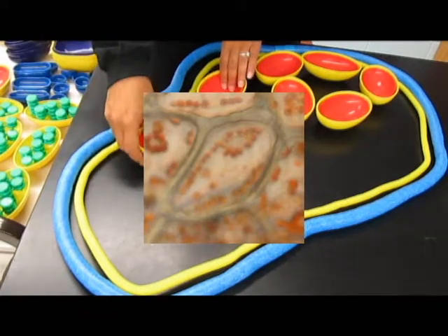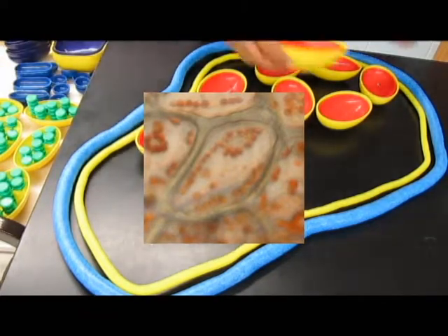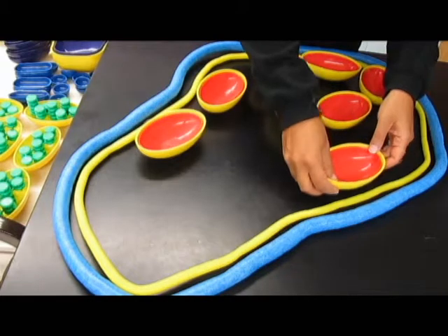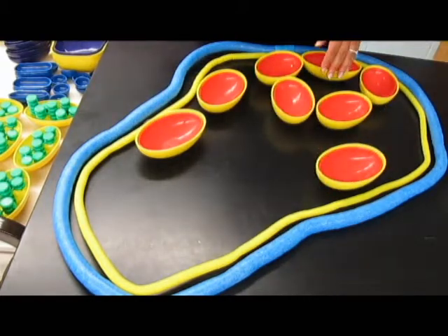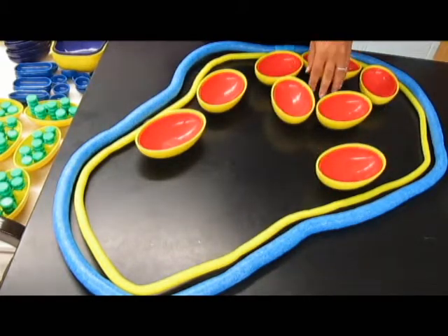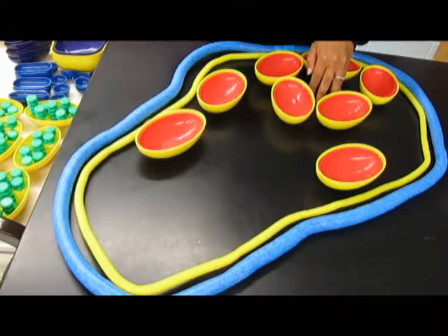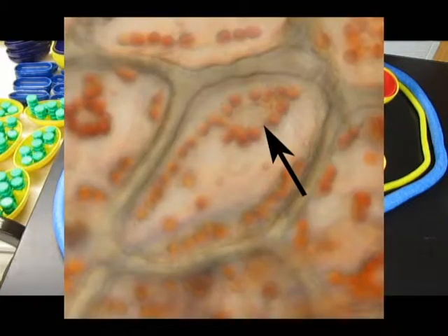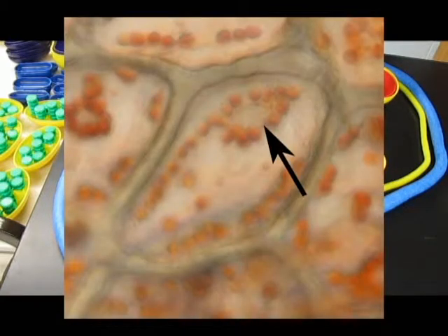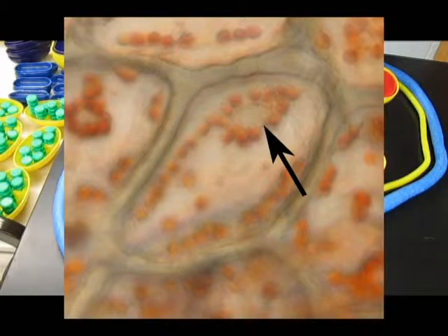There was a whole string up the side, and there was another on the other side. The cell that we saw, we happened to also see the nucleus in here — just a little bit of contrast — but we didn't stain for it, so it's hard to see.